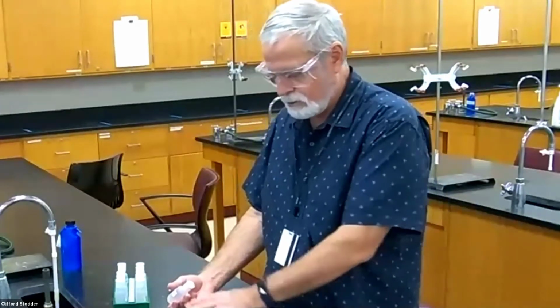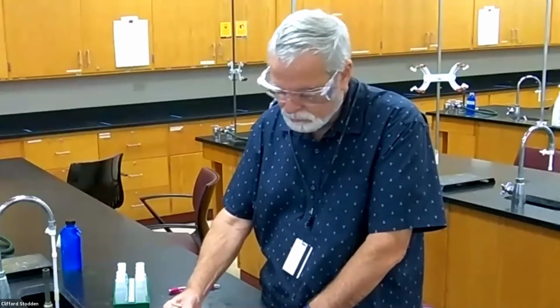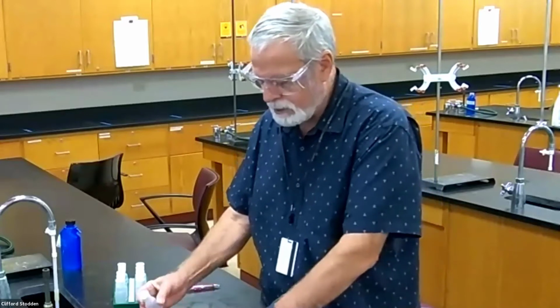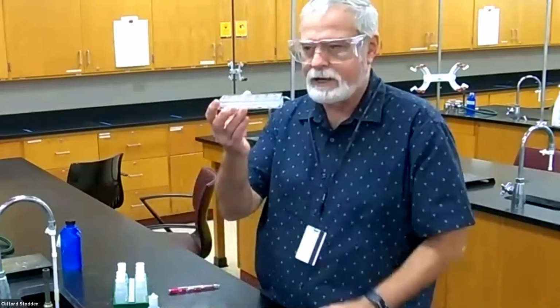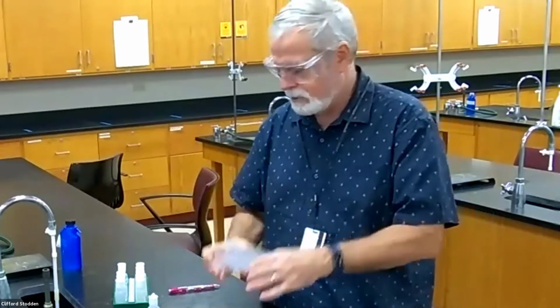There's only 6 spots across the well plate, and I'm not going to be doing all the combinations. So I'm just going to fill it up, maybe about 10 drops, should be about half of a milliliter in my well plate there in that first one. I know you can't see it right now.